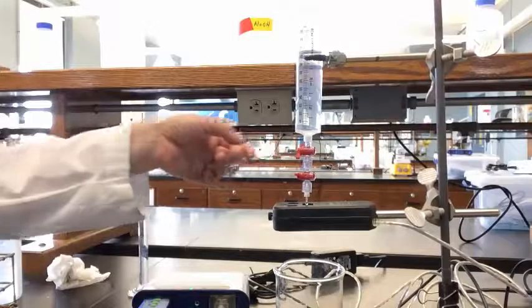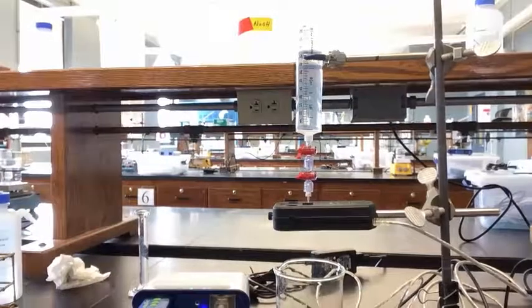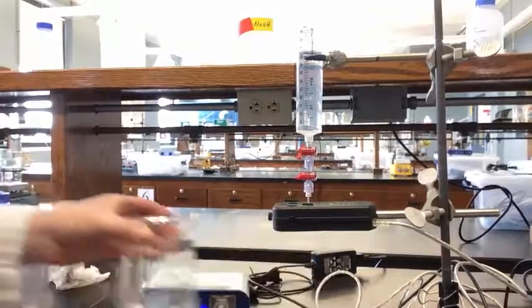Once you achieve this, turn off the bottom stop cock. Once the drop rate is set, put the graduated cylinder back in place.